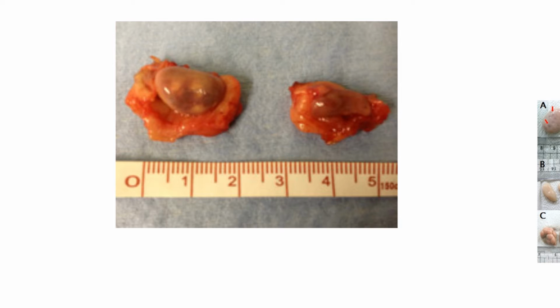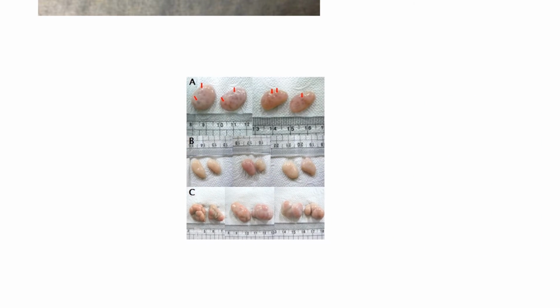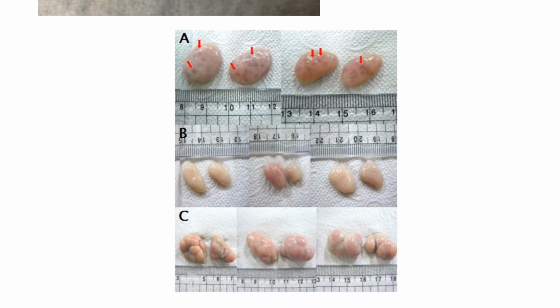So if you see this slide here, this is in centimeters, and from the 0 to 2.5, that's 1 inch. And you can tell that those two dog ovaries aren't even an inch across because this is all fat here. And then the ovary tends to be in a kind of thin membrane called, what I call at least, the bursa. So you would have to dissect in here to get to the actual ovary. Okay, so just trying to remind you what some of these things look like before we do the staining.